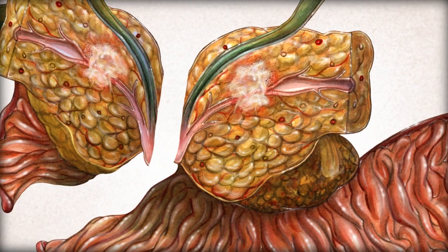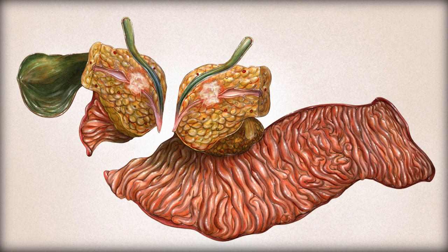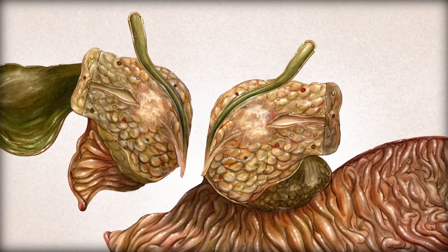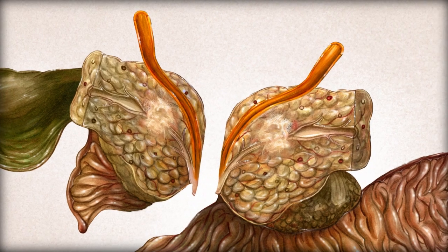Once the epicenter is identified, note the tumor's exact location and its probable site of origin. Measure its dimensions in centimeters. Describe its gross features, including whether or not it is cystic or solid. At this point, you may choose to fix the specimen overnight in formalin. Once it is fixed, paint the mucosa of the bile duct with orange ink. This will help identify the duct in later histological sections.